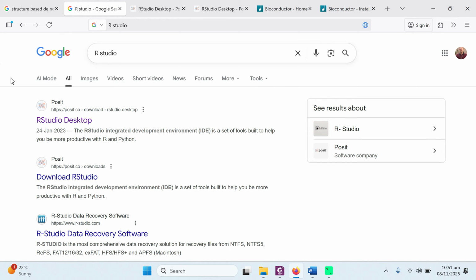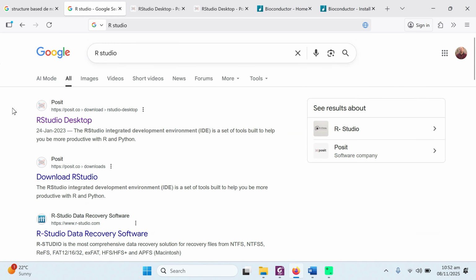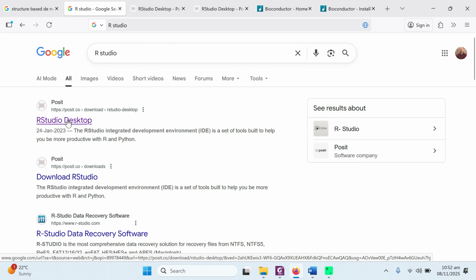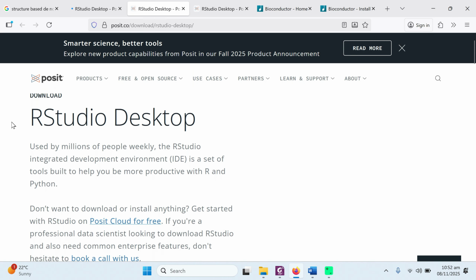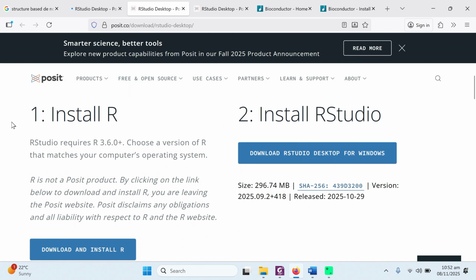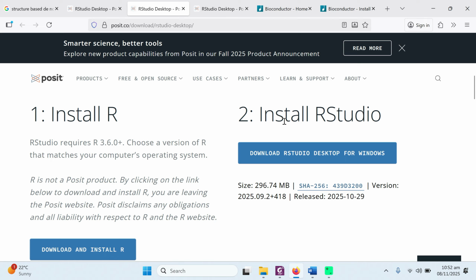First of all, you need to download and install R and RStudio. For this, go to Google and type RStudio. When you type it, the RStudio Desktop option will appear. You need to click on this, and on the next page you will be directed toward RStudio Desktop. First it contains install R, and at the second level you need to install RStudio.